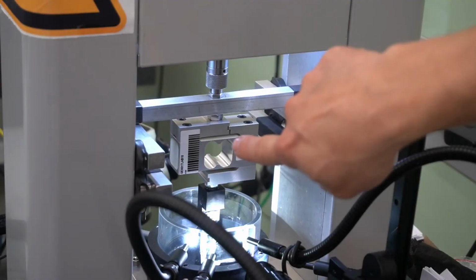The force data could be directly extracted from the load cell data, but the displacement, which is the change in length of the measurement distance, has to be extracted out of the video feed. And this is what you see here. So the points of the speckle pattern are tracked and averaged as the two lines at the top and at the bottom, and the distance between these two lines represents our displacement measure.